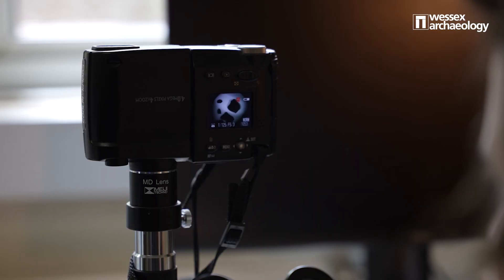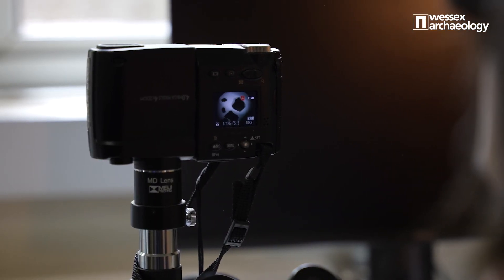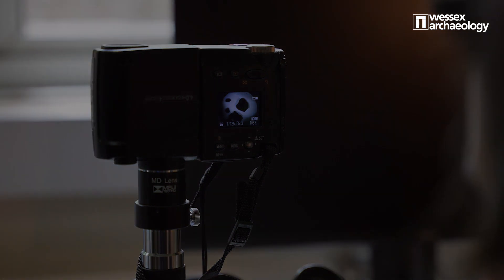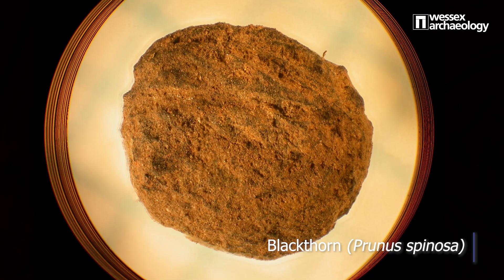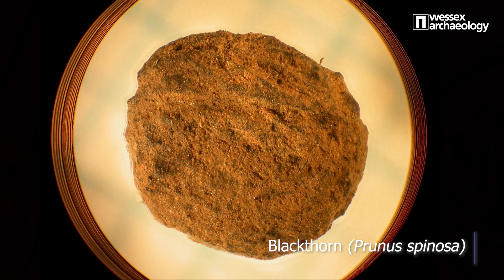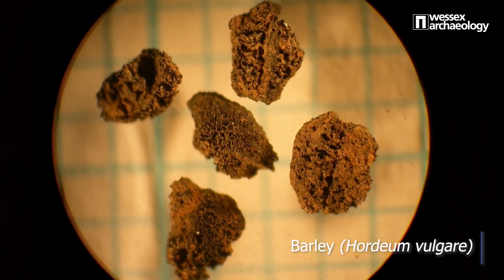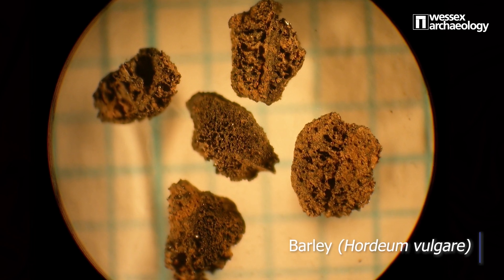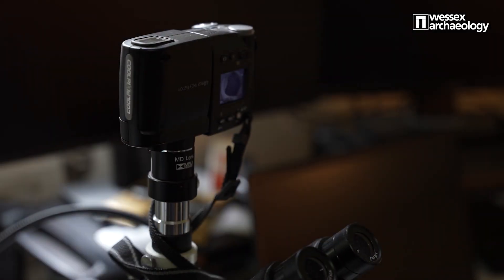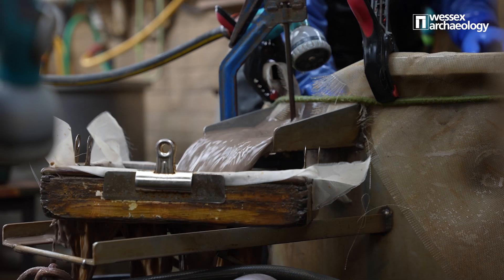We use the camera to photograph any environmental remains that are going to be destroyed, for example as part of radiocarbon dating, and also when we identify anything that is unusual or important. Ideally this would go into our publications so other researchers can see what we have identified and we can present our justification for providing that identification.